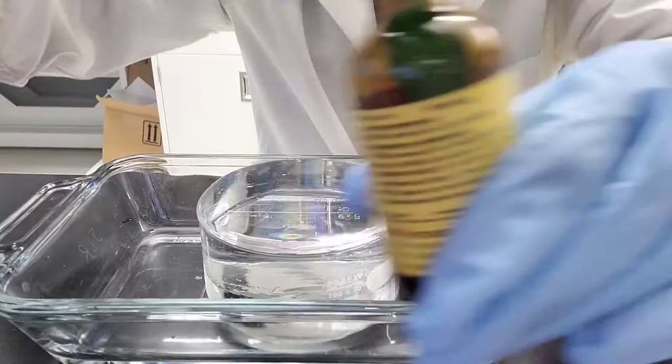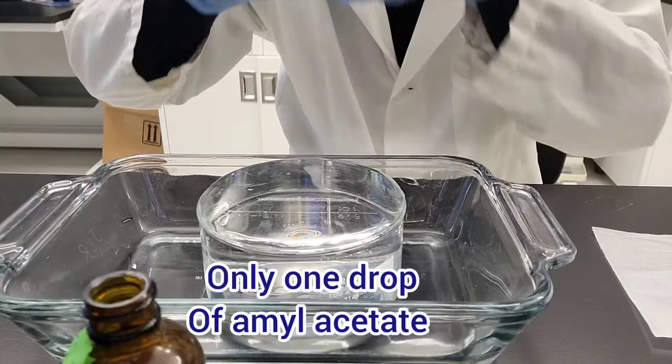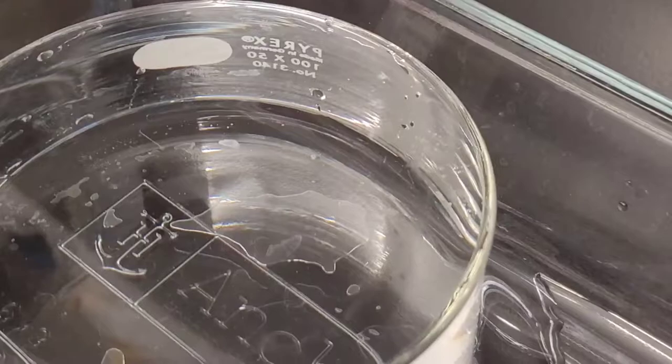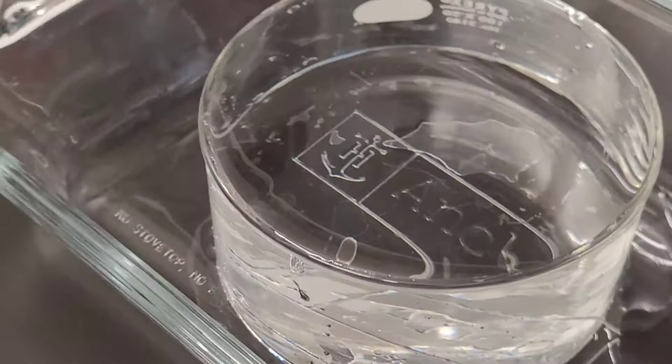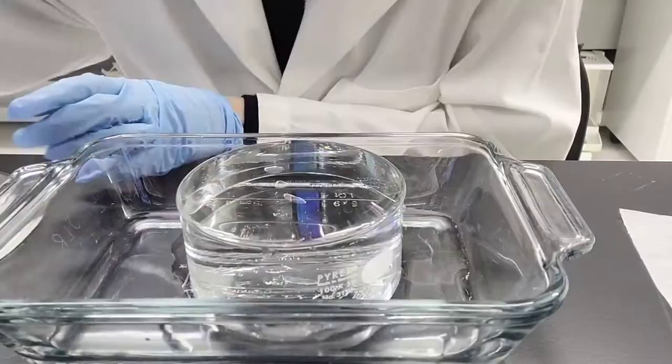The point of having a flat surface for the water is so when you put a drop of amyl acetate—and you only need one drop, no more and no less—it will create a layer on top of water. This way you can physically just be able to lay your grids on there. You have to wait a few seconds and then you will be able to see from the edges that a layer has formed on the water.